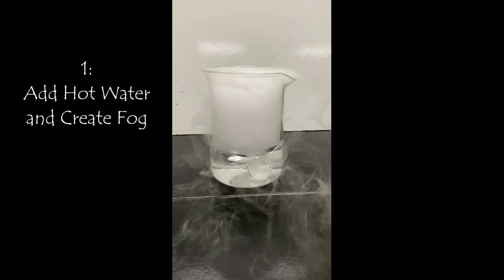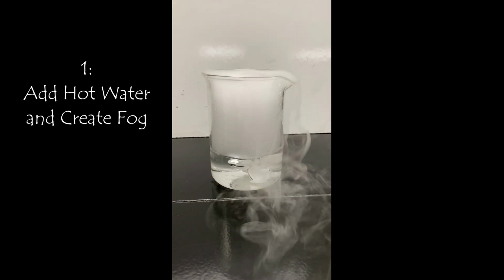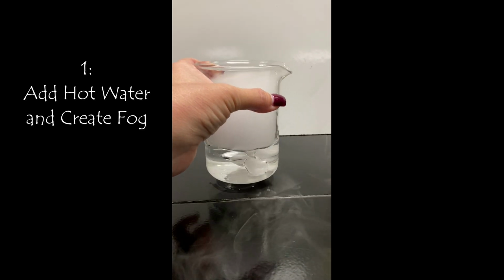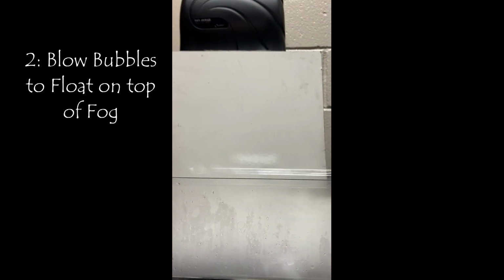So what I've done here is we are making this sublimate. We have put it in some warm water in just a beaker, and you can see that it is changing from that solid state directly into a gaseous state. So it is skipping the liquid phase altogether. So that smoke or that fog that you're seeing is the sublimation that's occurring of carbon dioxide in its gaseous state.